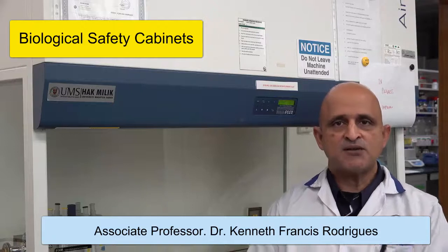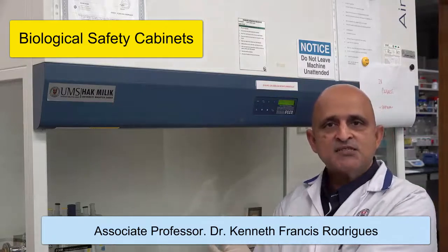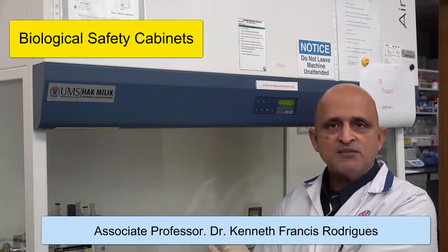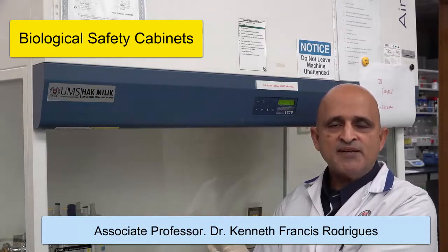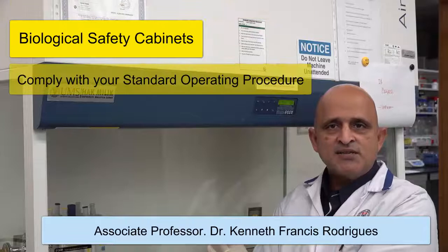This biological safety cabinet must be utilized in accordance with the administrative control or the standard operating procedures stated therein.